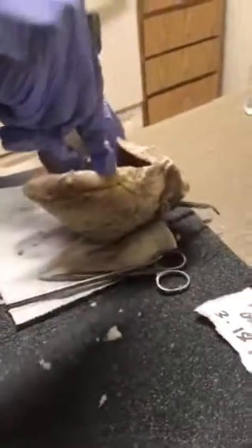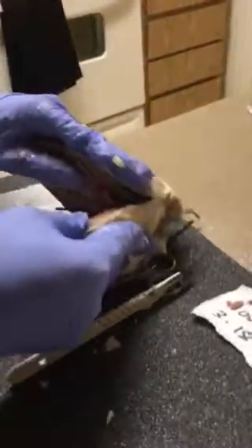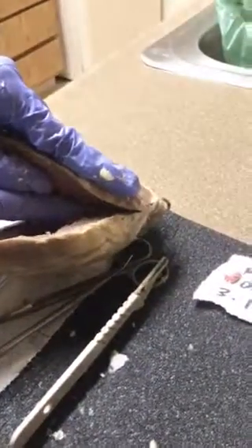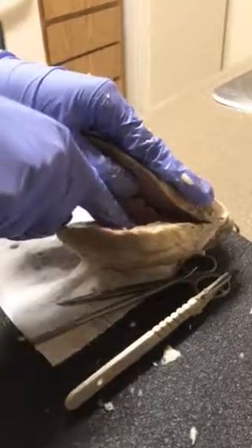Probably if I cut through here, I can show you the tricuspid valve. Yeah, so we have the tricuspid valve in here. It's very difficult to see. The tricuspid valve up there. And then we have the right ventricle and some fragments of the papillary muscle, with the right atrium at the very top in here.